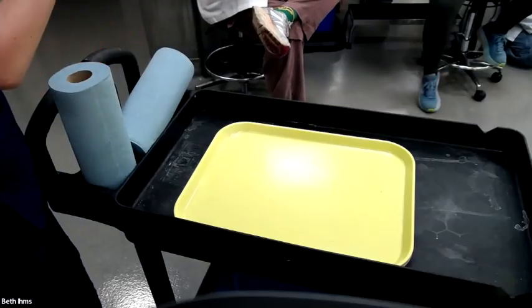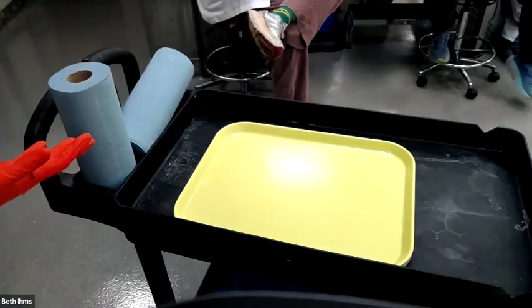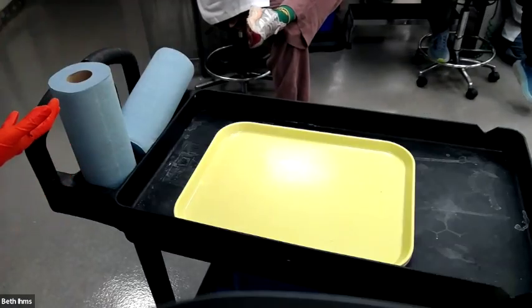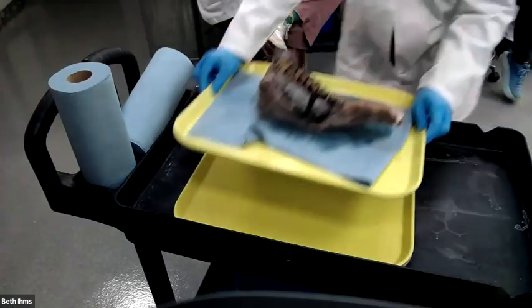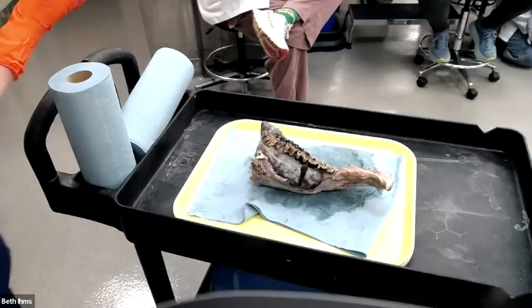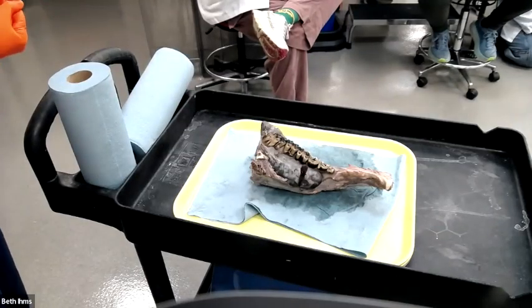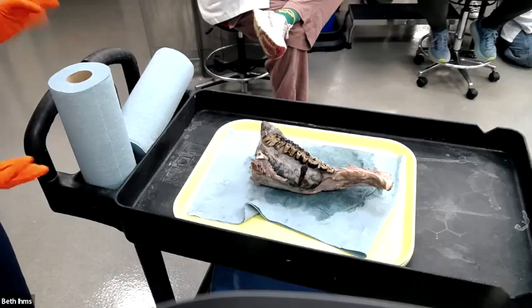The reason we're feeling the lung is we're trying to decide how much air is left in it and has it been replaced by anything. Your alveoli can be flooded with things like fluid. Pulmonary edema will have reduced crepitus. Hemorrhage will have reduced crepitus. Lots of things can cause reduced crepitus. We're looking primarily for infiltrative things rather than a mass or something. Does that make sense?